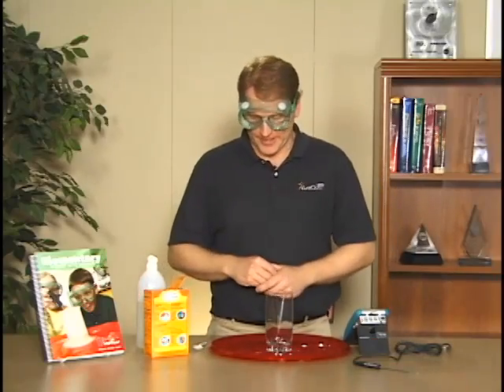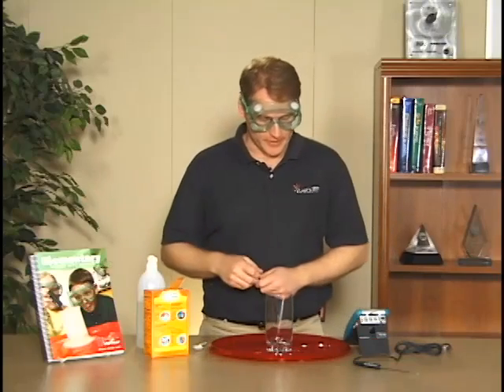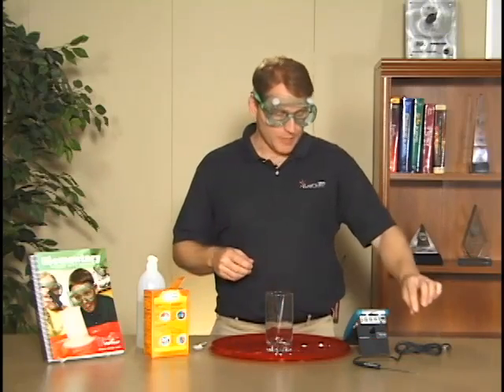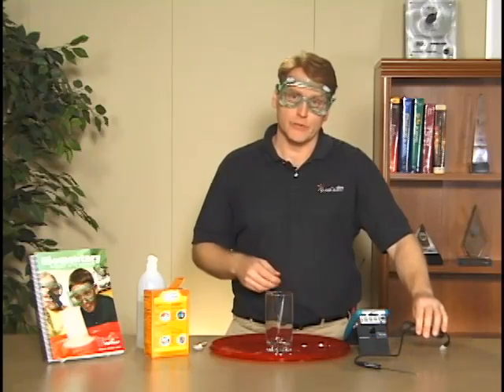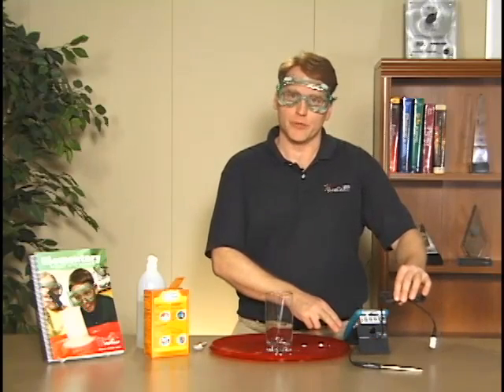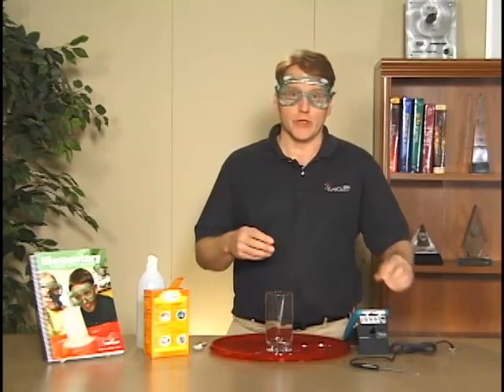That gets kind of fun if you look at the cover of the book, but what we're going to do is use the lab quest and the temperature sensor and record the temperature as that reaction occurs. Maybe we'll see a change when we do that.